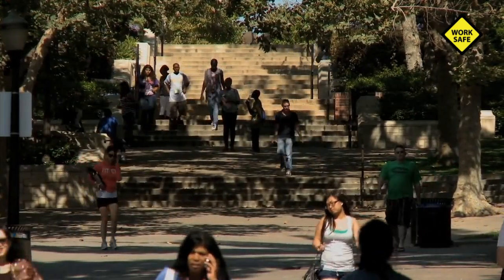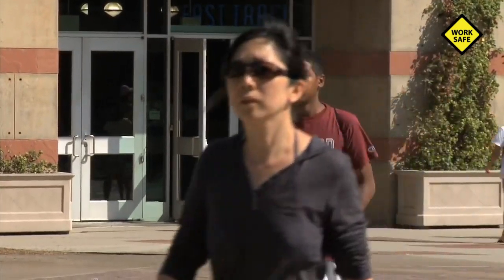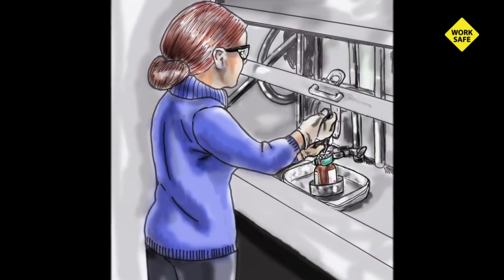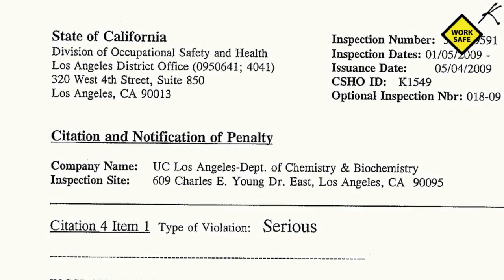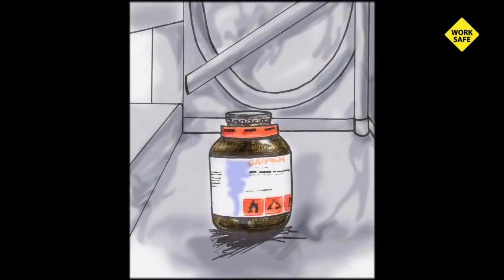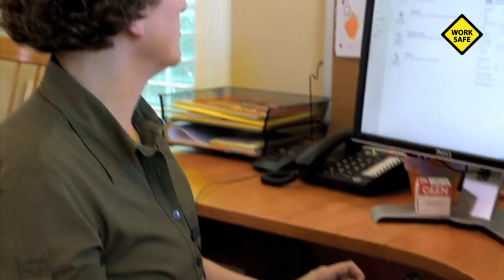On December 29th, 2008, when most of the campus was closed for holiday vacation, Sherry Sanji was working on a research project at the UCLA Chemistry Department. According to a report by California State OSHA, Ms. Sanji was using a syringe to transfer a solution of tertiary butyl lithium, a dangerous pyrophoric chemical that ignites spontaneously on contact with air.